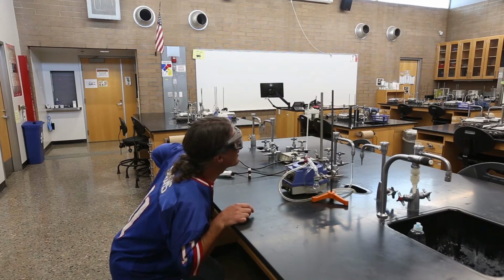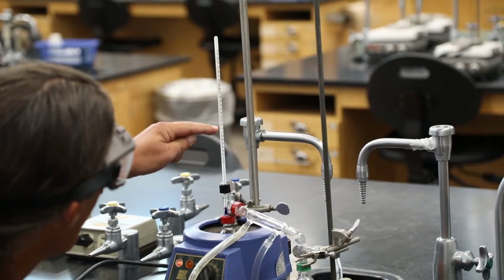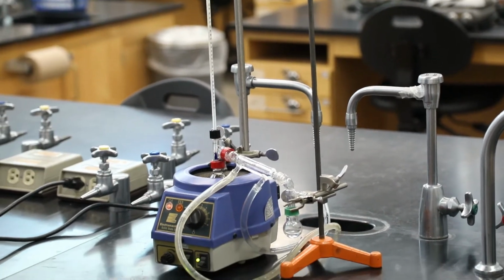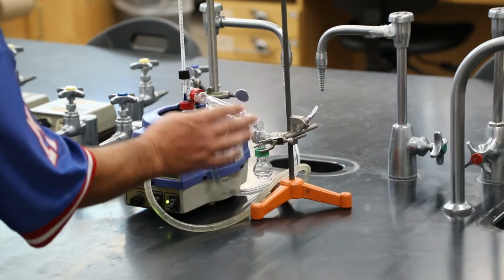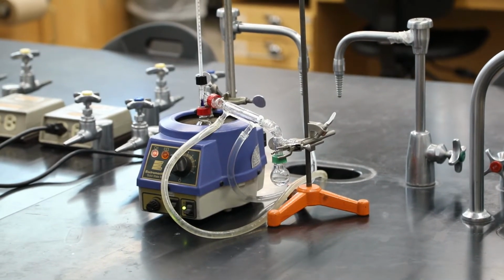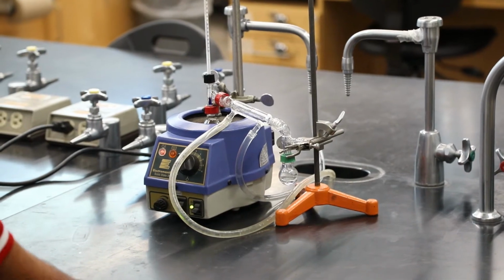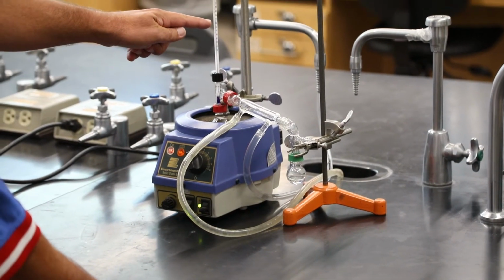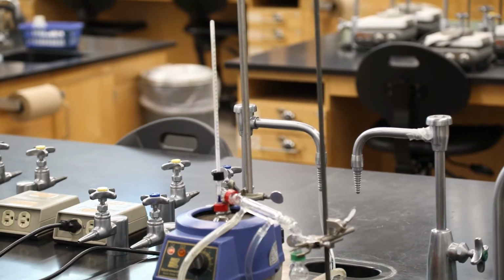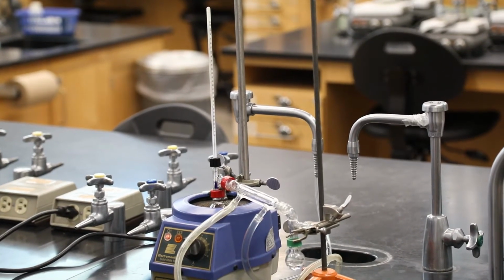I'm expecting it to be 66 degrees, but I want to verify that. If this starts going up, we're starting to get an impurity coming over, and that's when we'd want to stop the distillation, take this stuff as pure, and then not get the higher boiling contaminant in there. So if we have a mixture of liquids, this temperature would not stay constant. It'd change as we continued the distillation, and as some of the higher boiling liquids started to distill over.